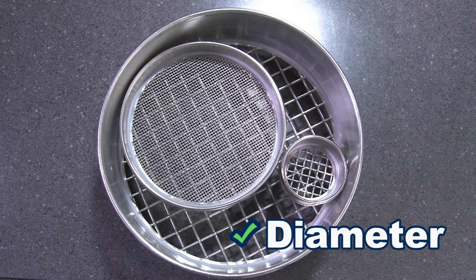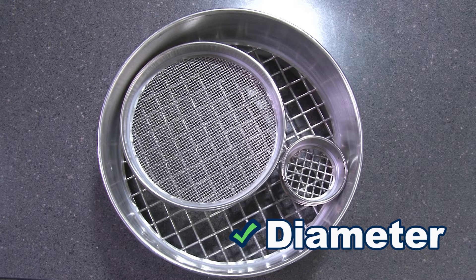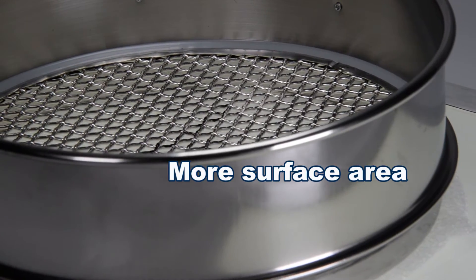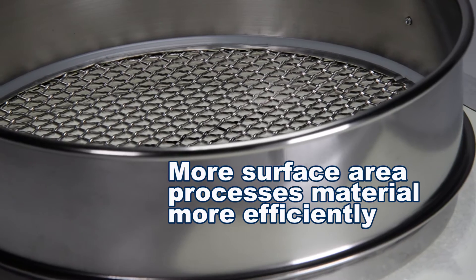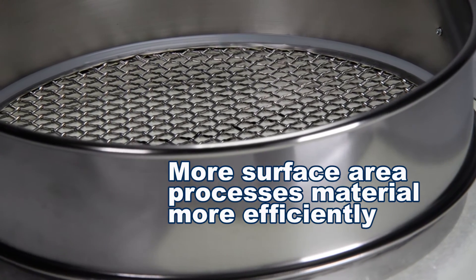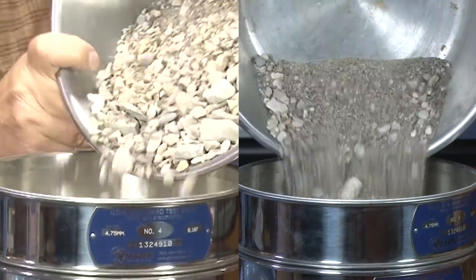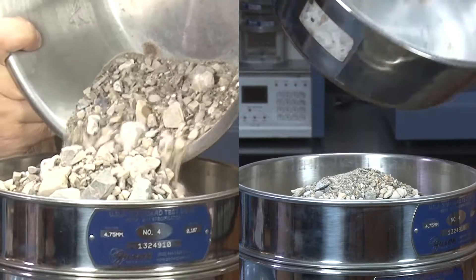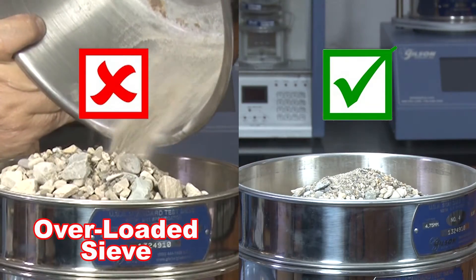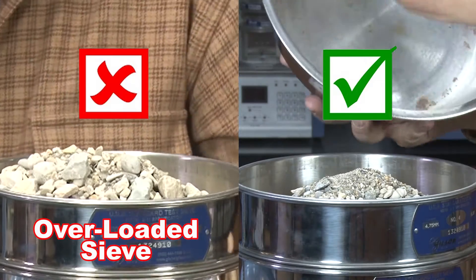Frame diameter is a crucial consideration in matching the size of the sieve to the sample volume. A test sieve with more surface area processes material more efficiently when testing higher sample volumes. When a large volume sample is tested within a small diameter frame, not all of the particles are properly exposed to the mesh openings, resulting in poor separations and inaccurate test results.